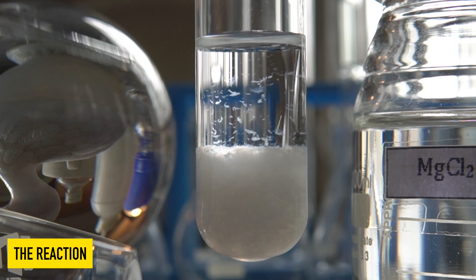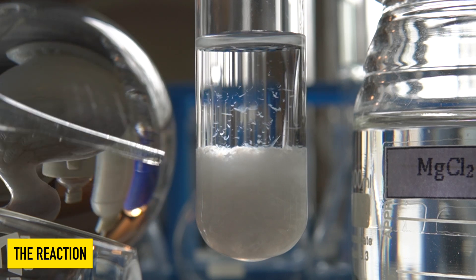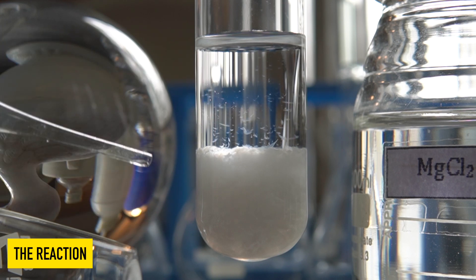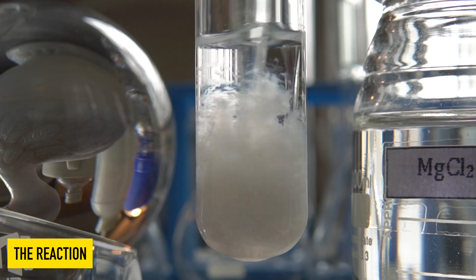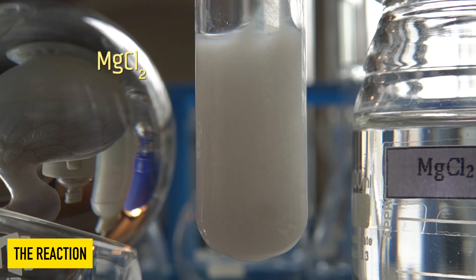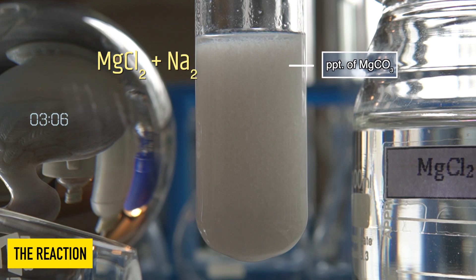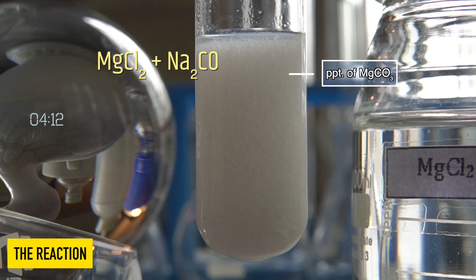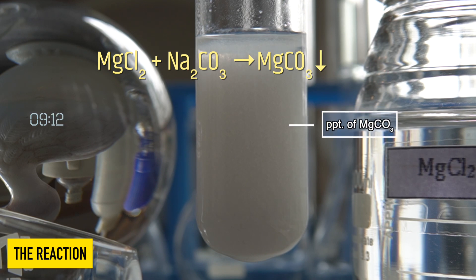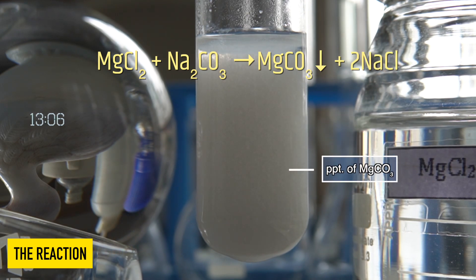The white insoluble precipitate that has been formed at the bottom of the test tube is nothing but magnesium carbonate. So in this reaction, magnesium chloride reacts with sodium carbonate to produce an insoluble precipitate of magnesium carbonate along with sodium chloride.